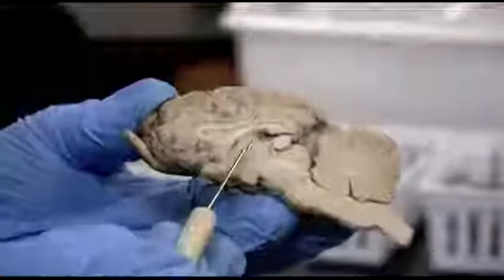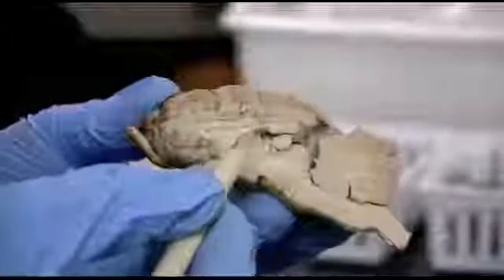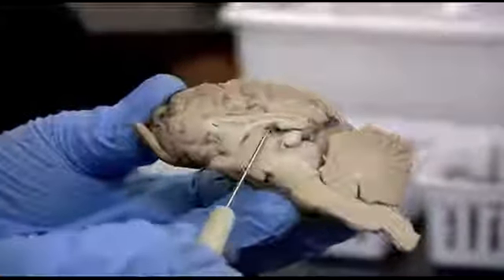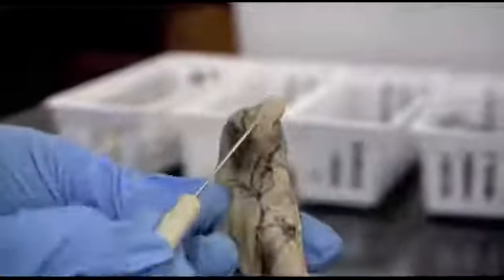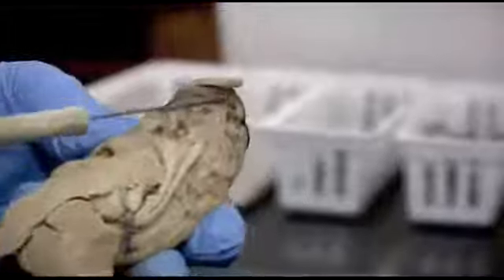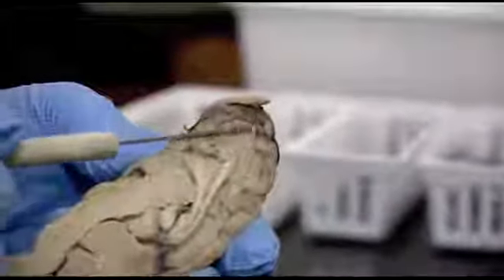The information is going to go up eventually to the different cortices of the lobes of the cerebrum. So it's important that everything goes through this thalamus except for one particular nerve, and that's the olfactory nerve with the olfactory bulb and olfactory tract, because it has direct connection with the nerve and the cerebrum. So therefore it doesn't need to go through the thalamus.